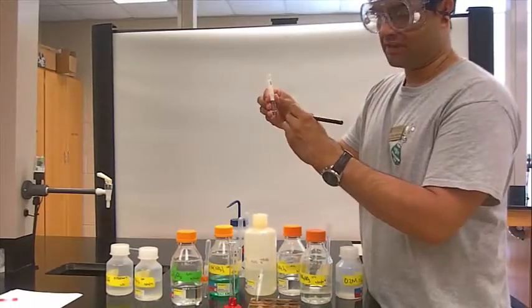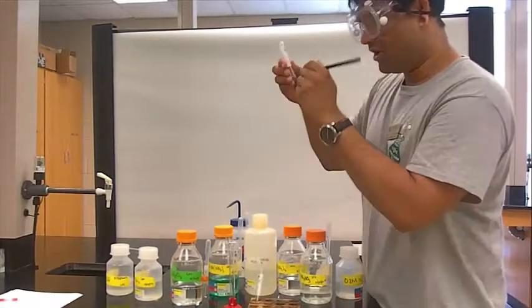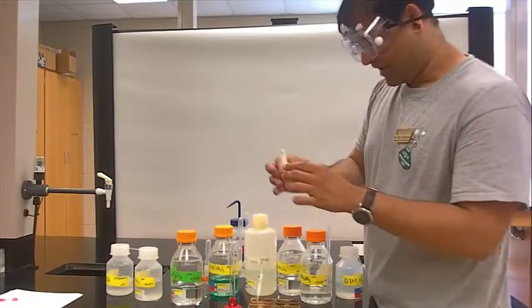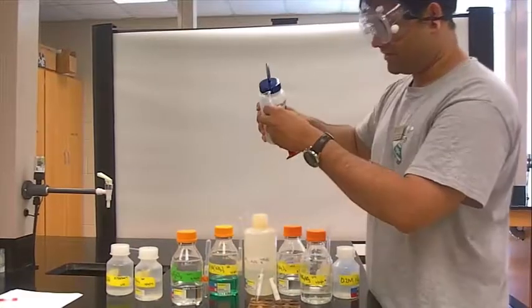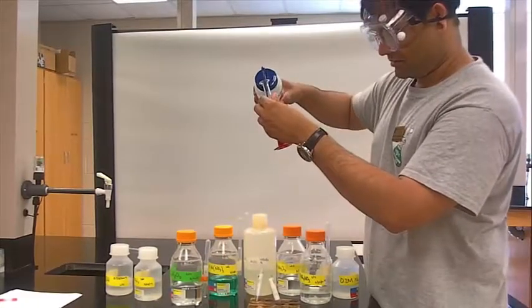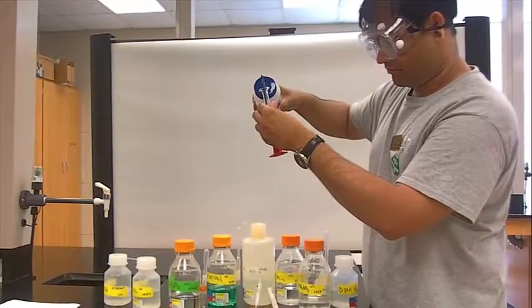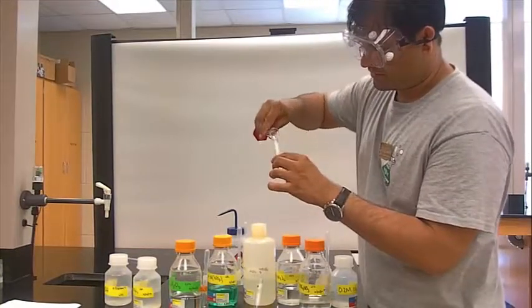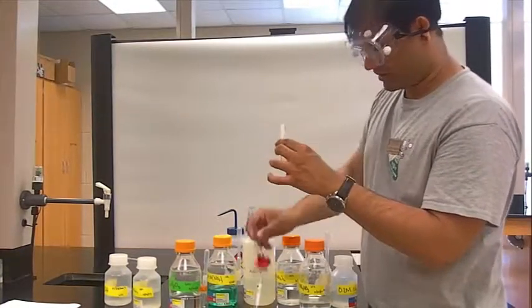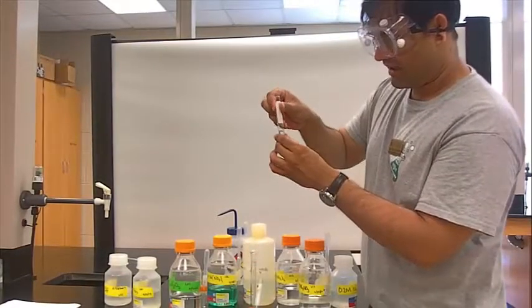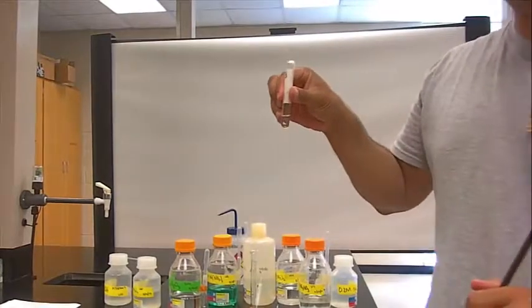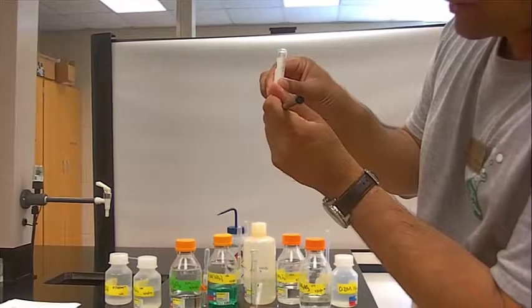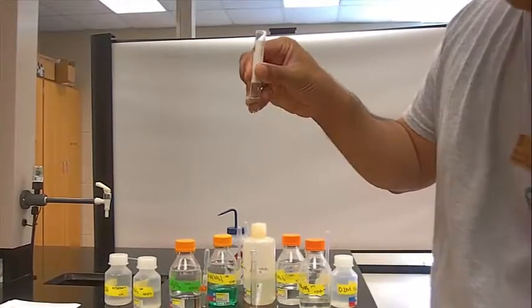We have these pencils that you can use to just mark where the one mil line is at, and I'll do it one more time on that same test tube. About another one mil. I already have my one mil mark, and now I will have my two mil mark. My one mil mark, and this would be my two mil mark.